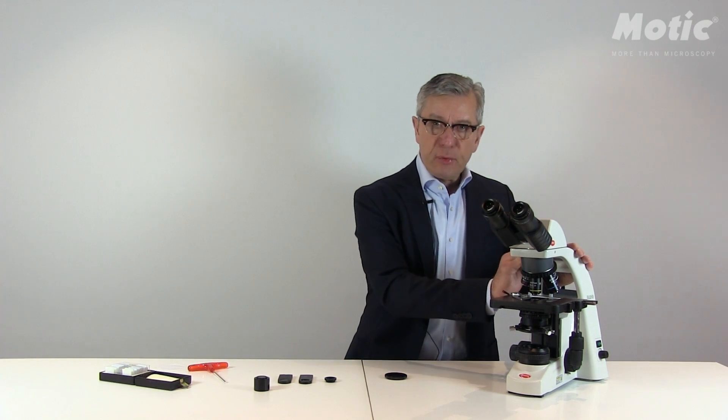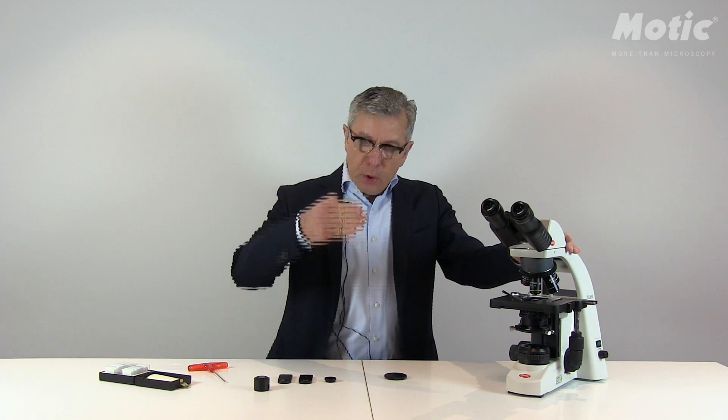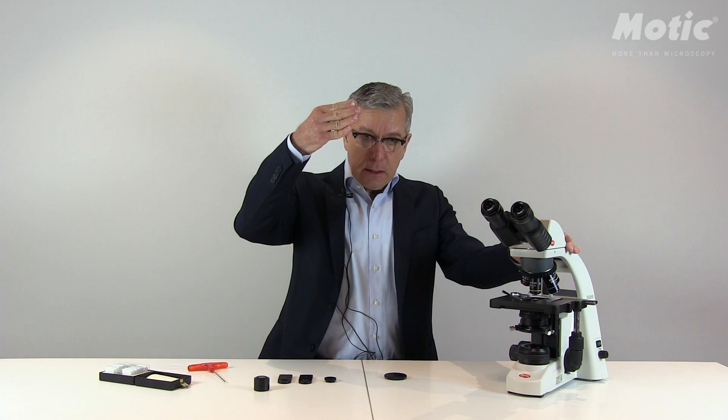How to detect birefringence? For birefringence we need two hardware pieces. The first one is a so-called polarizer, which will be placed on the light exit of the microscope — in this case a BA310 Elite, representing all BA210 and BA310 upright models. The polarizer filters out linear polarized light, which is oscillating only in one direction.